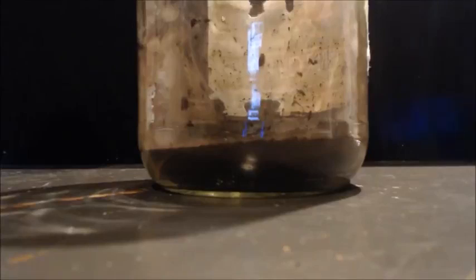So I put it in there, and I'm going to wait until I have all my experiments done with potassium permanganate, or at least until I get this jar halfway filled up, or at least a third of the way or something. Because you're going to lose a lot into the filter, and it gets a fine precipitate into the water when you clean it.